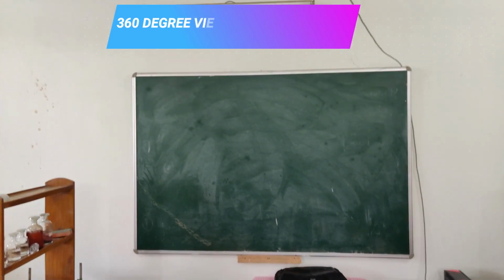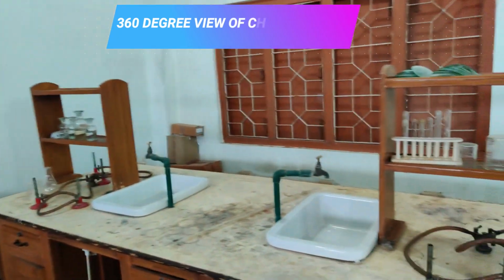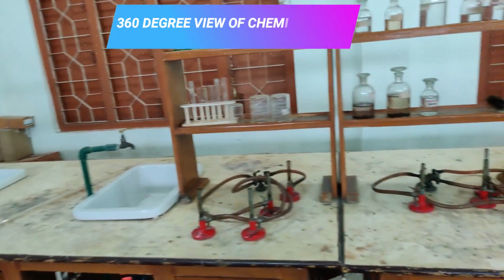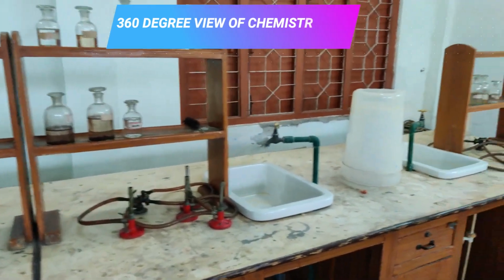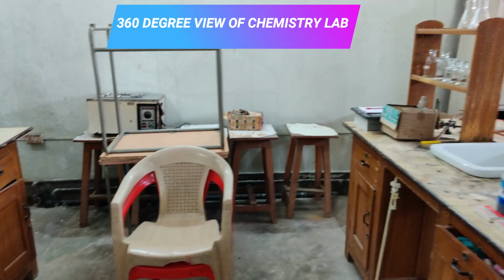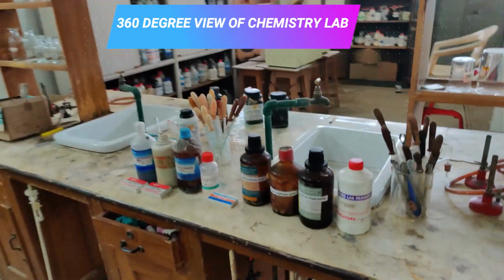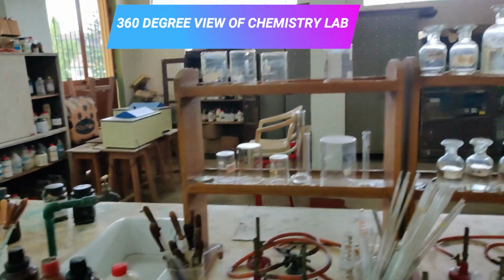So this is the green board in the front. This is on the right side. Here we have the racks. Since they have not been used for a very long time, you can see they are all very dusty and not in the best of forms. This is not how our chemistry lab actually looks. Here I have made some chemicals ready for your practical.